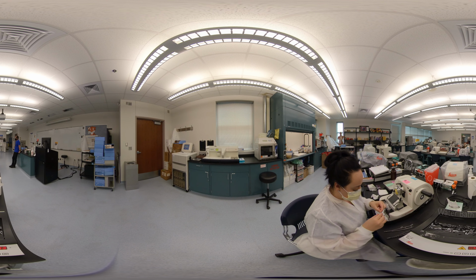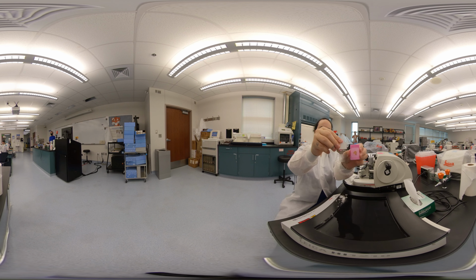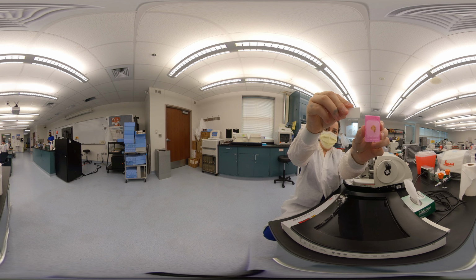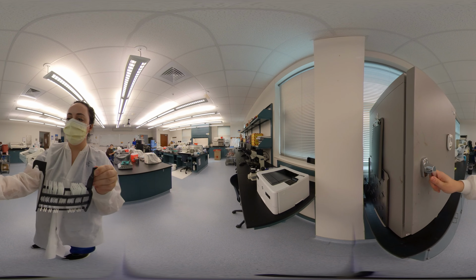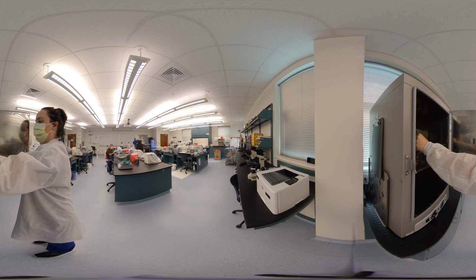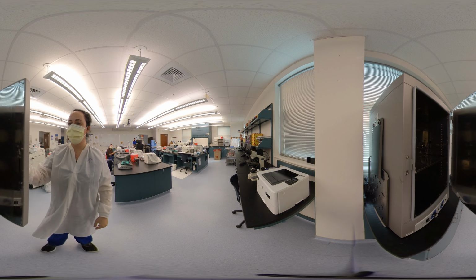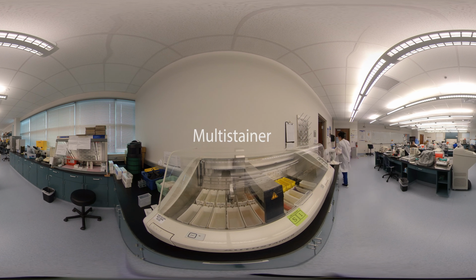This is what it looks like when the slide and corresponding block has been cut. Notice the mirror image on the block and slide. Before we can stain tissue that is on slides, we need to heat fix the tissue to the slide. We do this by placing them in an oven. Once they're removed from the oven, they go to the multi-stainer. Look for the word multi-stainer to identify its location.